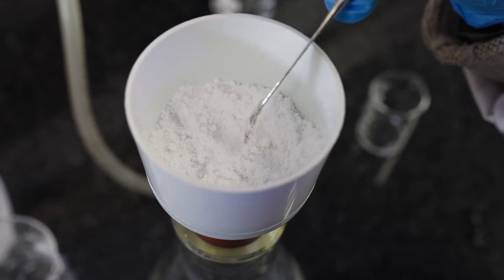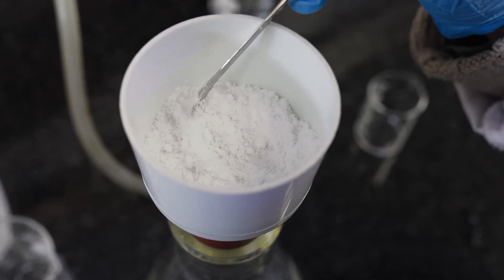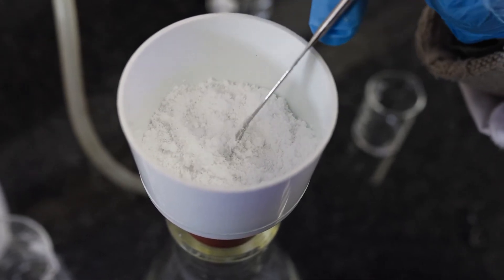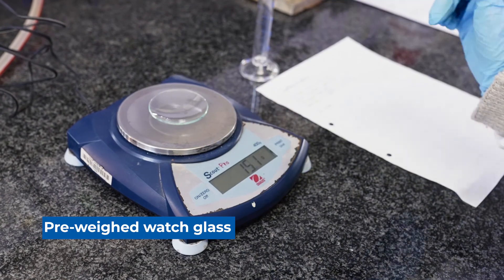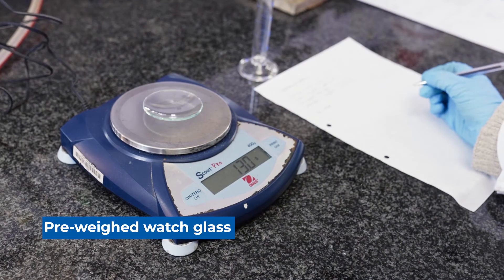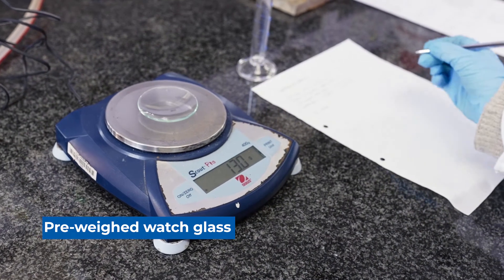When they're dry like this, this is when we can weigh them. First we need to weigh the watch glass before we add the crystals.